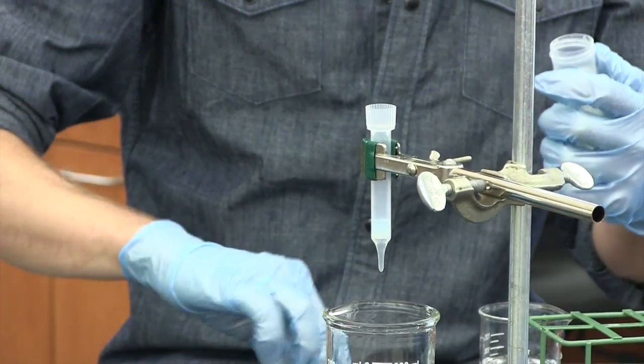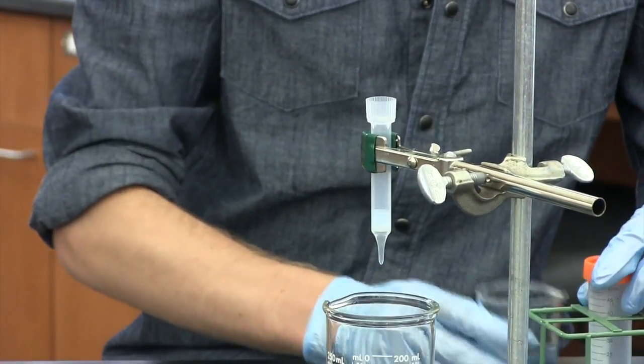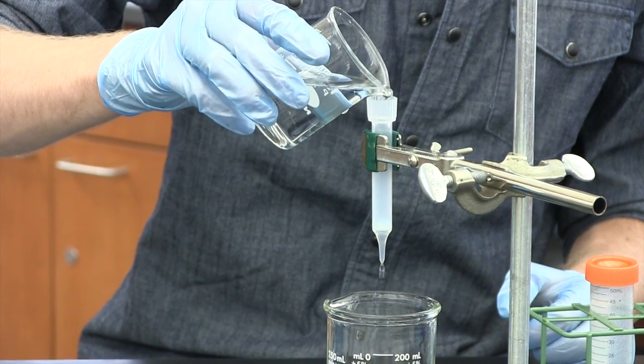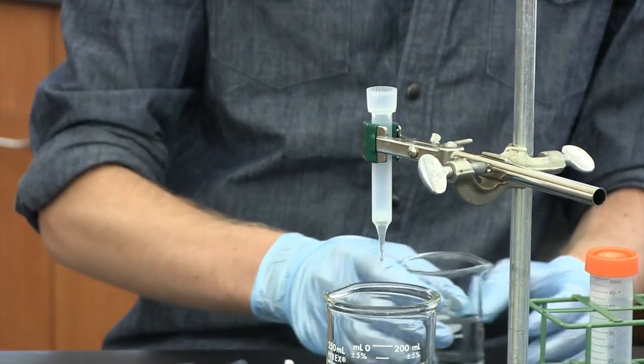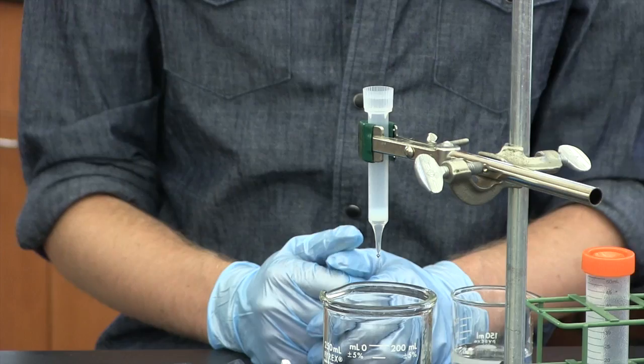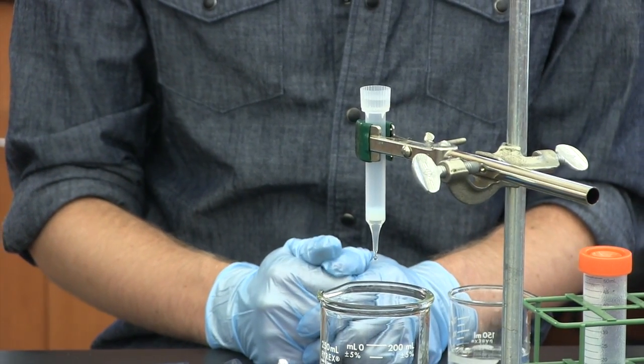Then you want to add buffer as it's going. We just have to let it run down so that the nickel gets settled there above the frit.